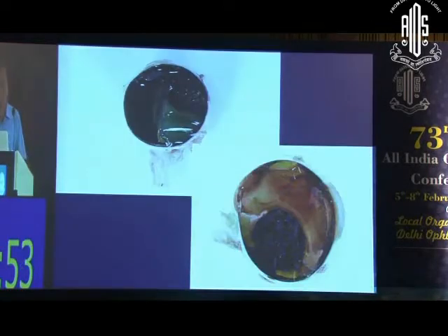Okay, but again, before I gross the specimen, I do a transillumination test. Can you see this pigmented tumor over here? That's how a melanoma would look. This is the gross cut section of the eyeball. Can you see this tumor? That's the melanoma. You have the detached retina and subretinal exudates over here. That's again a mushroom-shaped melanoma. Why does a melanoma appear mushroom-shaped?